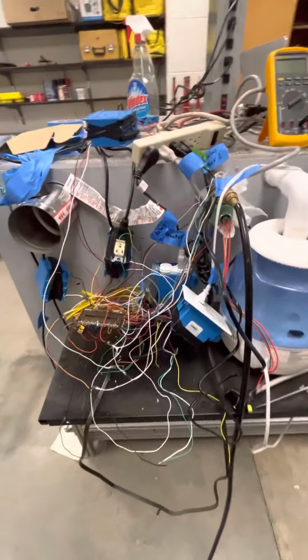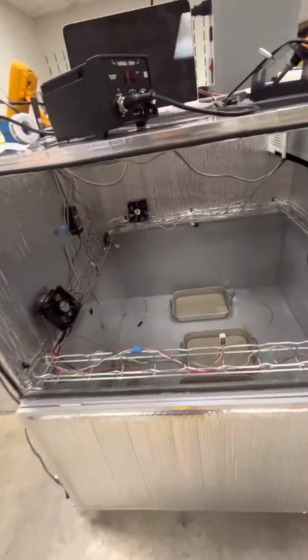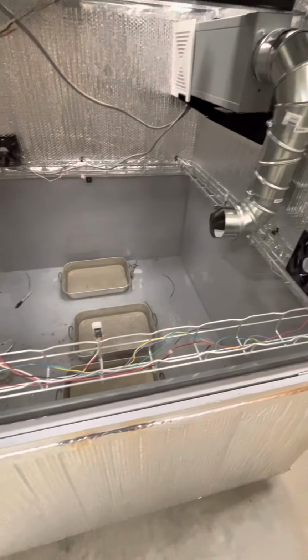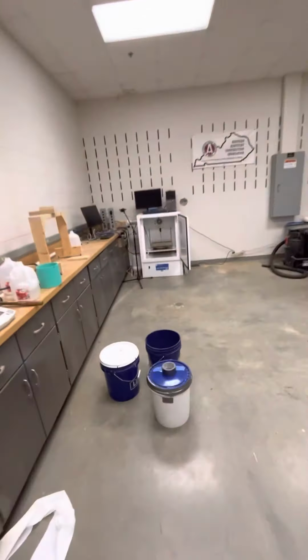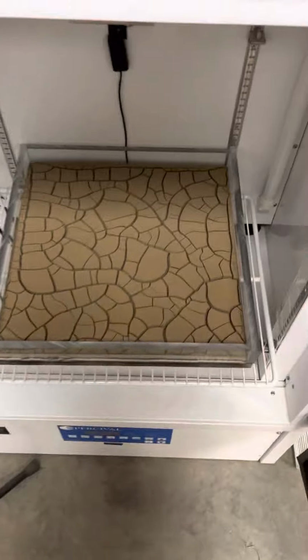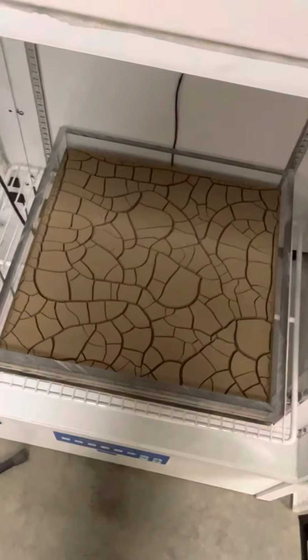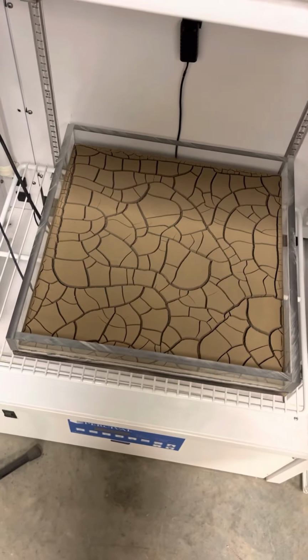This is a chamber I helped a faculty member at Murray State build. It's for testing CO2 flux inside the dirt based on dirt cracking patterns. So this is a smaller chamber that's just temperature controlled, but doesn't have CO2 measurements. Basically what happens is you put dirt inside of here in liquid form. So it's just basically mud, and then over a period of time, we're examining how the dirt cracks, and we have a web camera for that, which is going to be integrated inside this system.